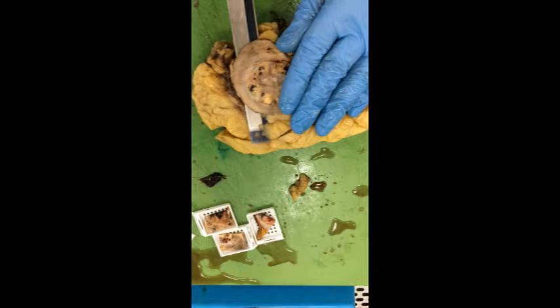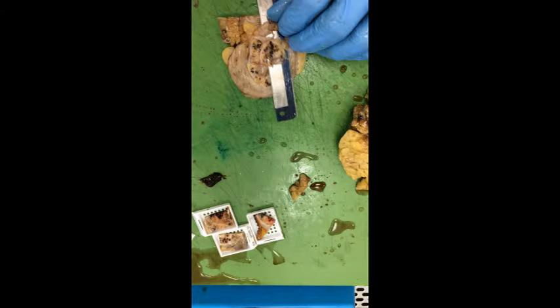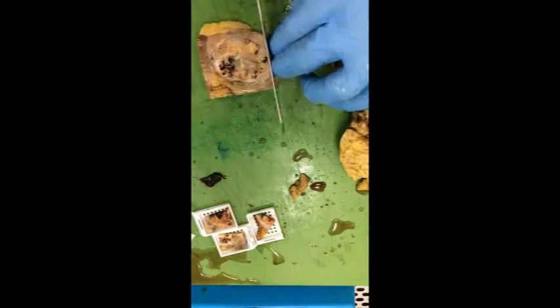The most important area to sample well is the renal sinus. This tumour has little area of sinus interface, but take this area either as longitudinal sections or perpendicular to these. This can be taken in small or large blocks, but the important area must be sampled extensively.